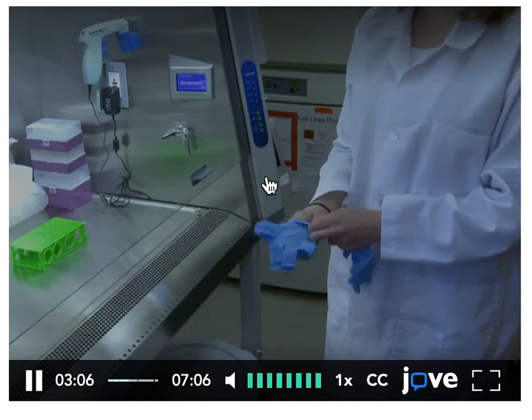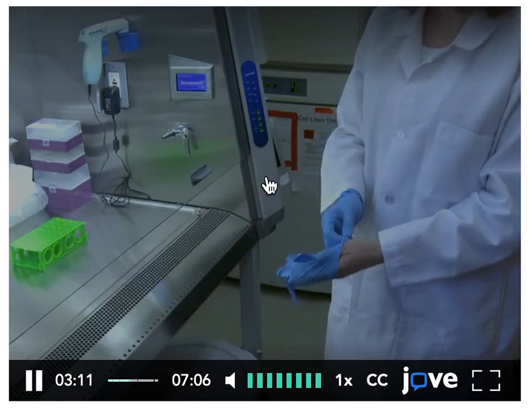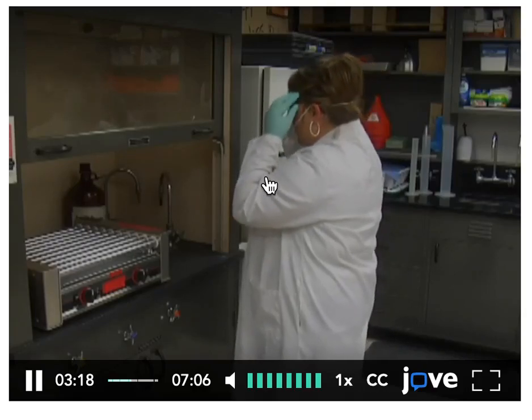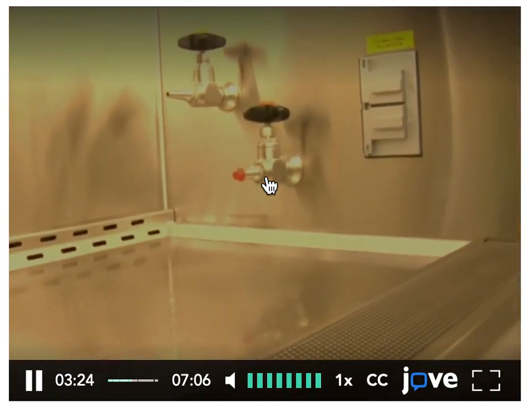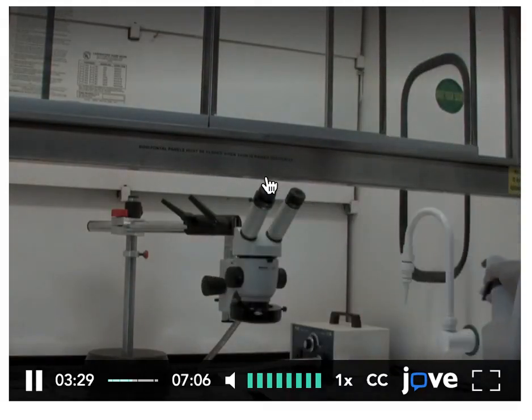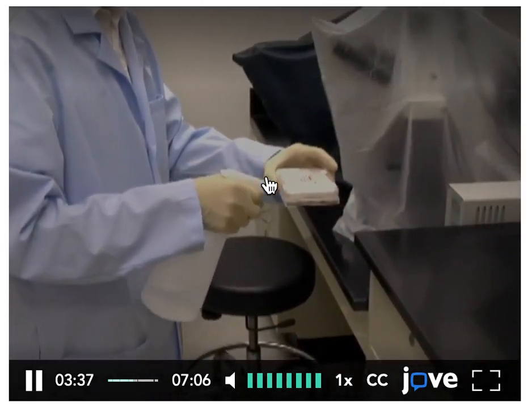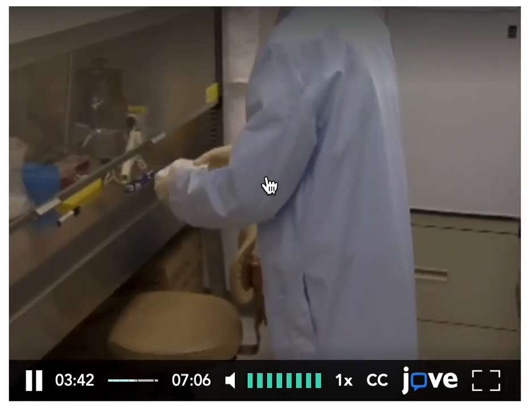After choosing the correct hood type for your experiment, next be sure to use the appropriate personal protective equipment, or PPE. Put on gloves, goggles, and a mask as necessary. If an aseptic environment is required for the experiment, such as within a tissue culture hood, start by spraying down the hood surface with 70% ethanol. This disinfects the surface and quickly evaporates, leaving no residue. Also, be sure to spray each object with 70% ethanol as it is placed in the hood to maintain a clean environment.